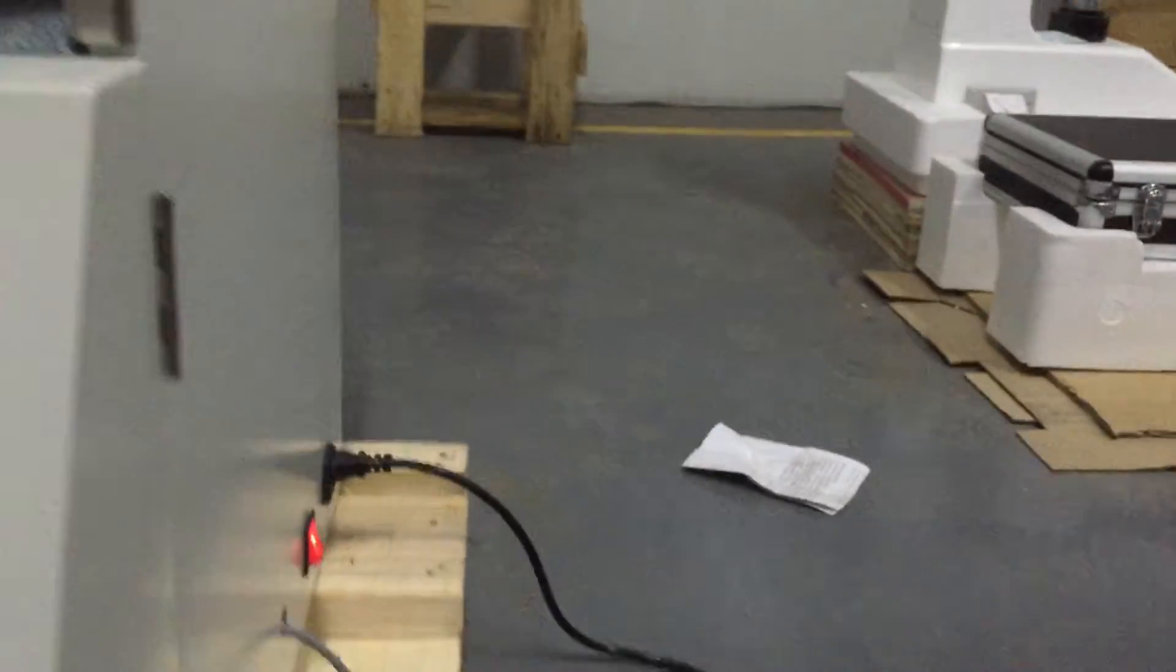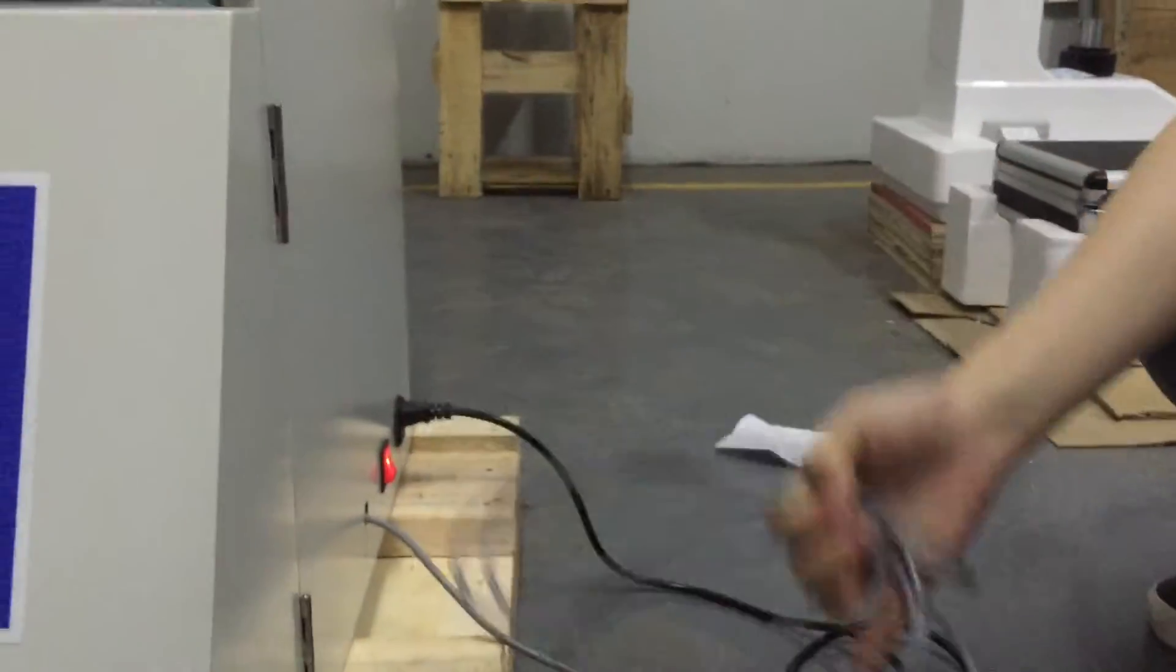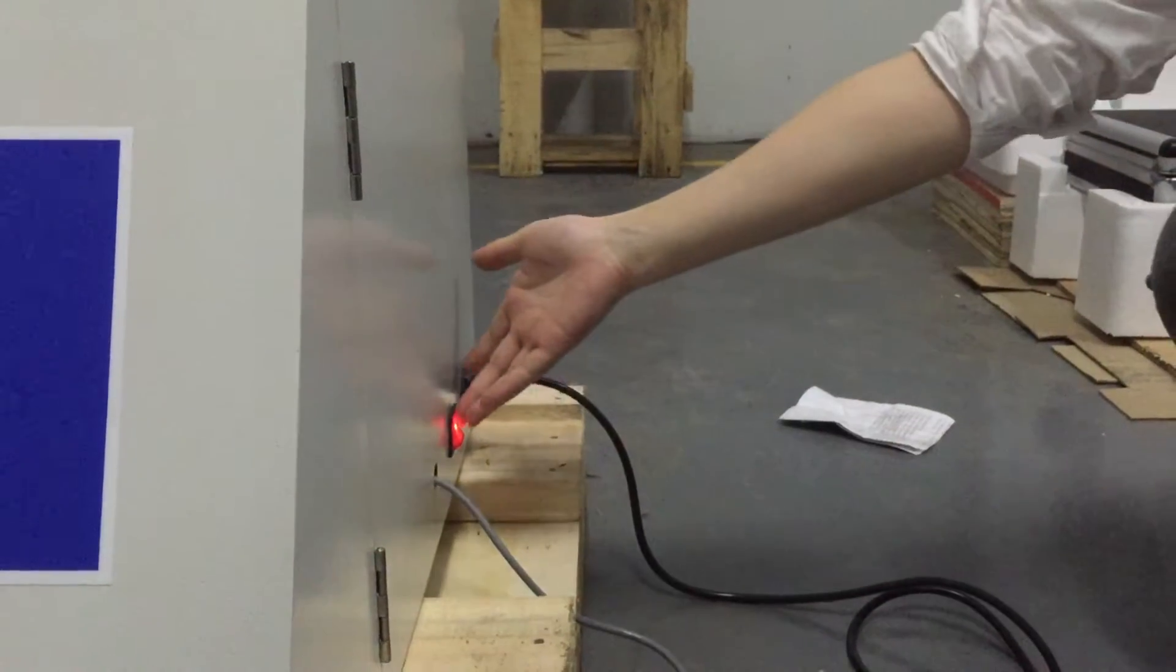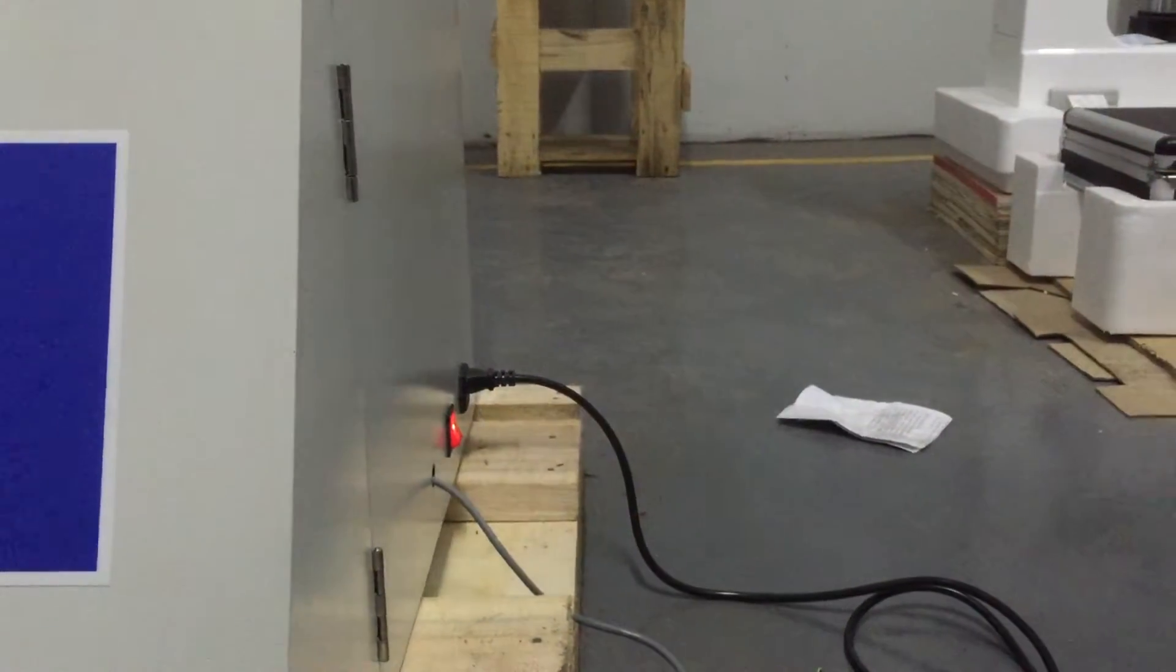On the right side, there is the computer connection line, the machine power source line, and the power switch of the whole machine.